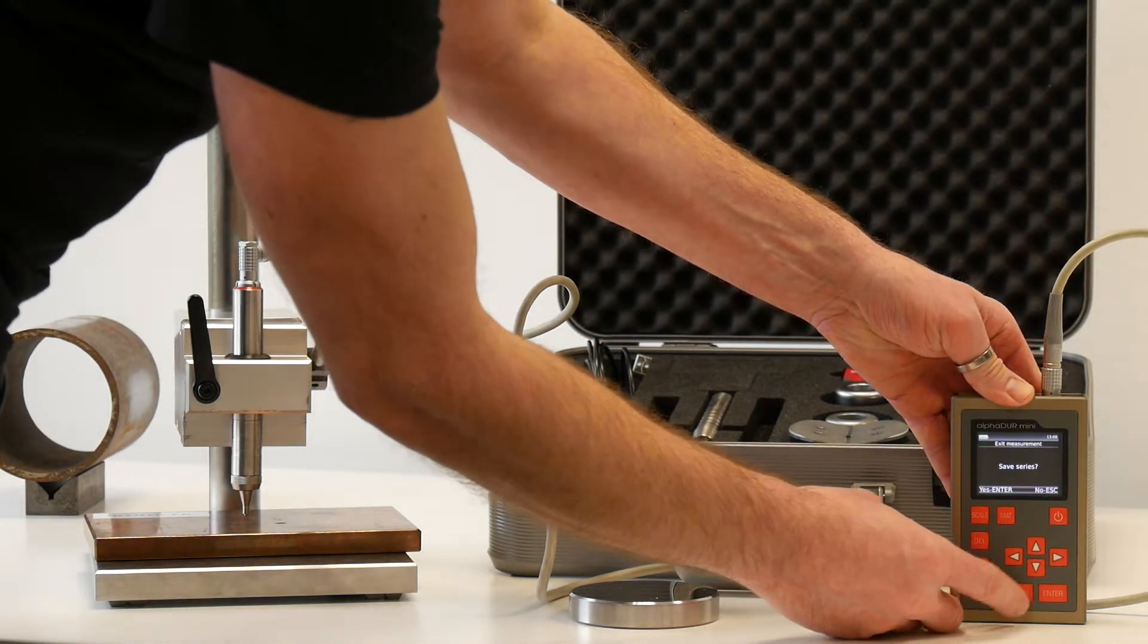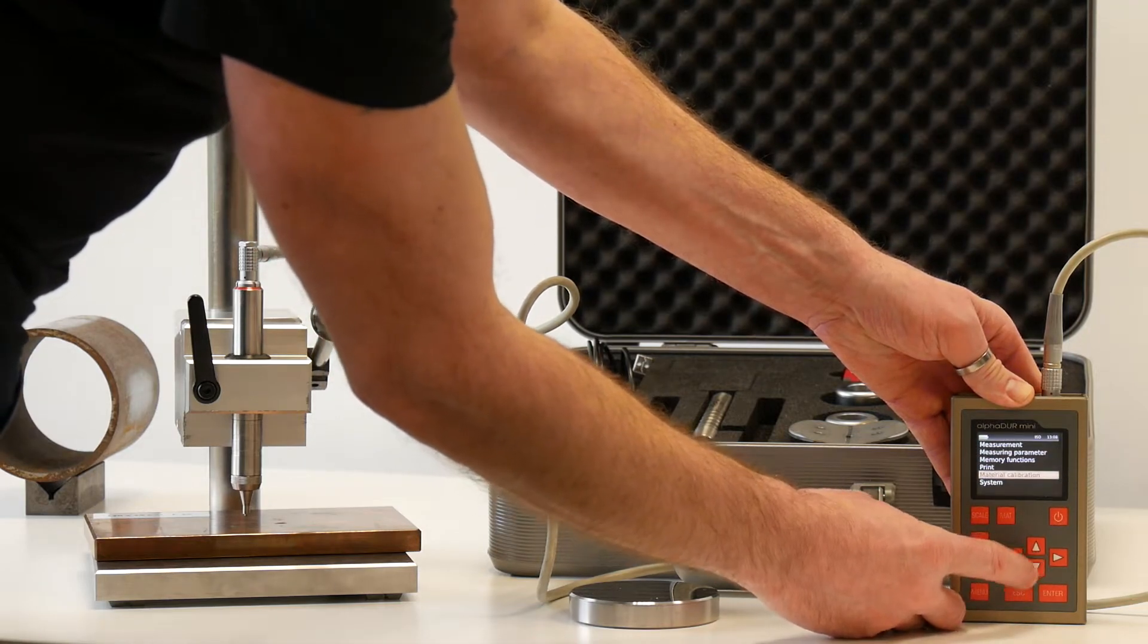We have to go into the menu and choose the point material calibration.